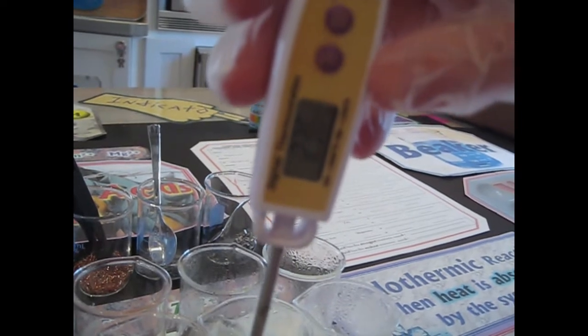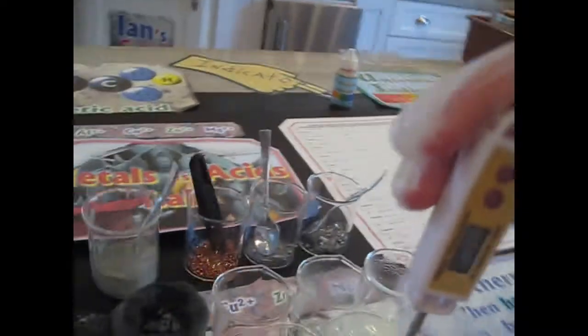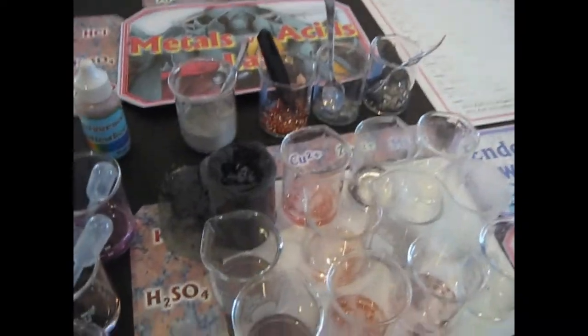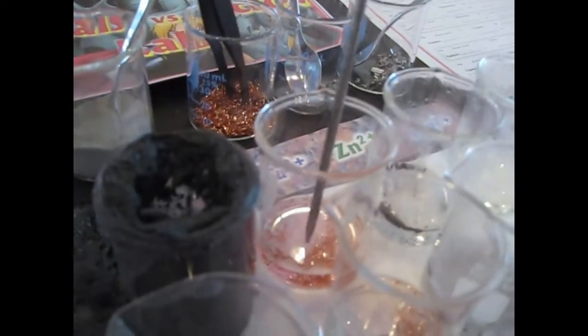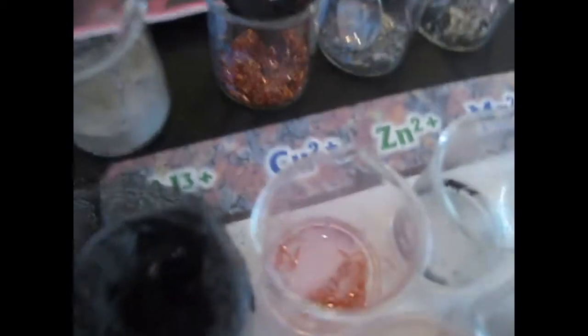So the funny thing about these is these might not have changed at all because it was 23. Like they had no reaction. I mean, no visible reaction, and maybe no reaction whatsoever. Okay, try the next one. Is it similar? Yeah. Try the next one. Oh, this one, interesting. 25. So there must have been something going on there, although maybe it's not very visible.